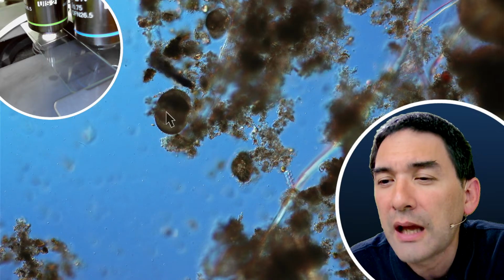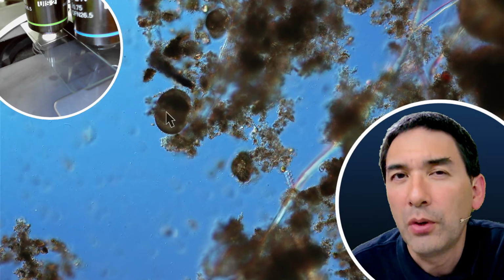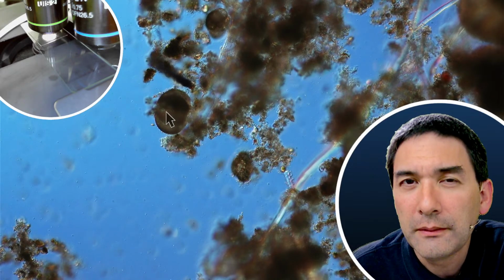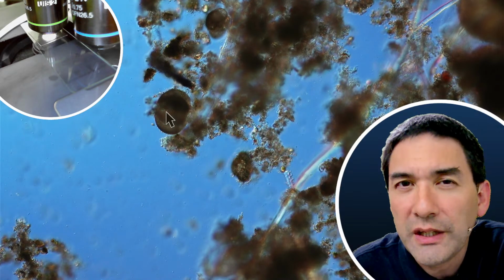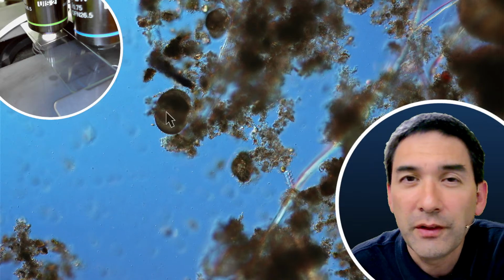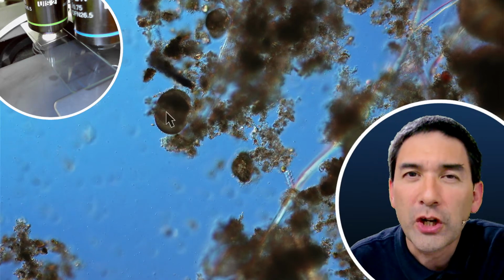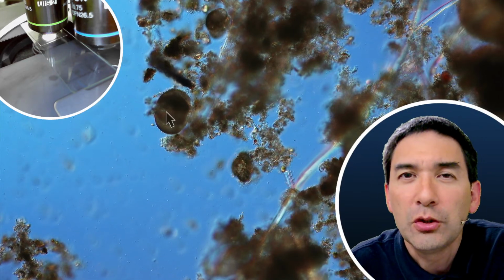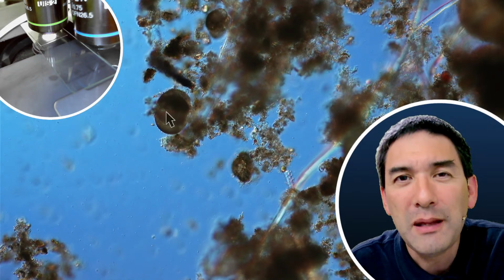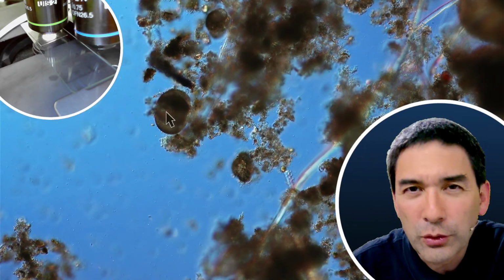Should you look out for a certain type of moss? As I just said, it's not so much the type of moss that I found out, but essentially the moss that I used was quite green and lush. Sometimes the moss is a little bit dried up, and even though the tardigrades are able to survive also dry moss, I found more of them in fresh, lush green moss. It could also be that they like to cling to the moss, so maybe there are tardigrades there, but they simply didn't come off the moss. So you do have to shake the moss a little bit in a little bit of water to try to wash them out.